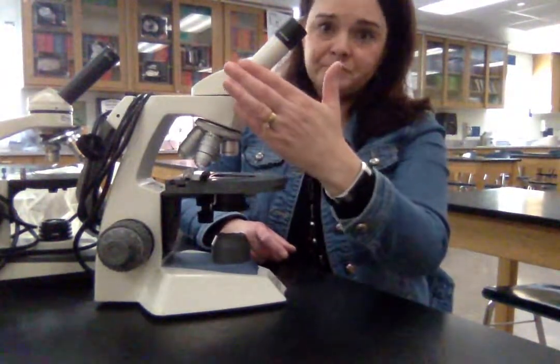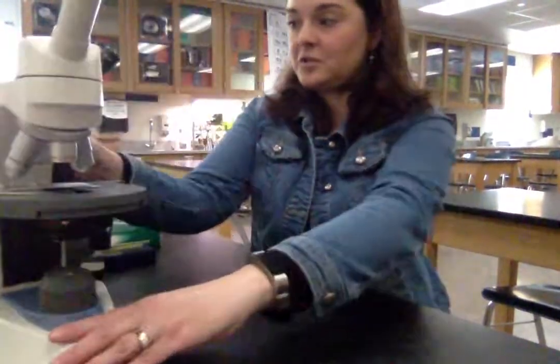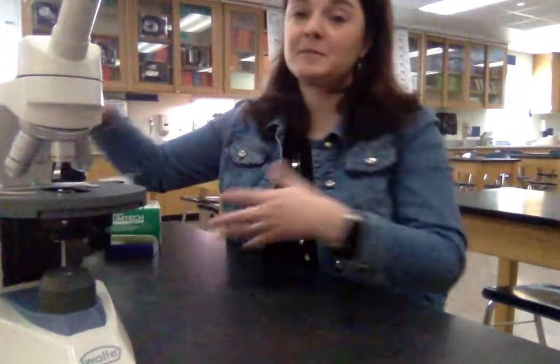We have the eyepiece, and sometimes this part is called the body tube. Microscopes come in a variety of different shapes, so they might not be configured exactly like this. We have an arm, and the bottom is called the base. On this microscope, there's actually a mirror inside to direct the light through the lens down through the objective. Sometimes people get caught up when labeling microscopes because the diagram doesn't look exactly like the one in front of them — that's okay, the parts are still the same.